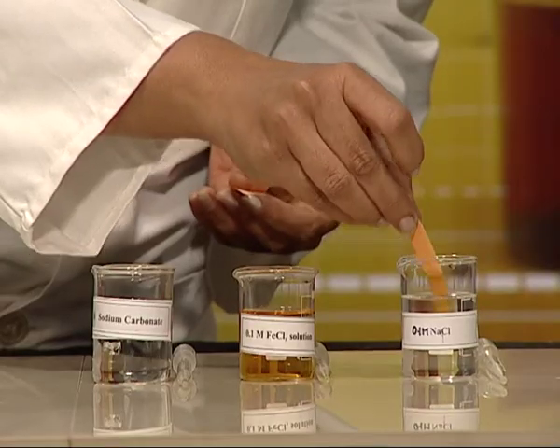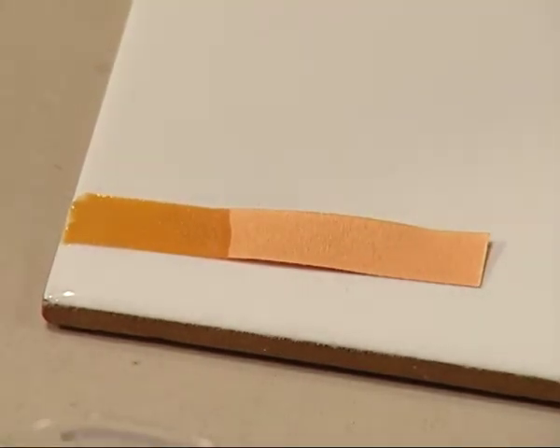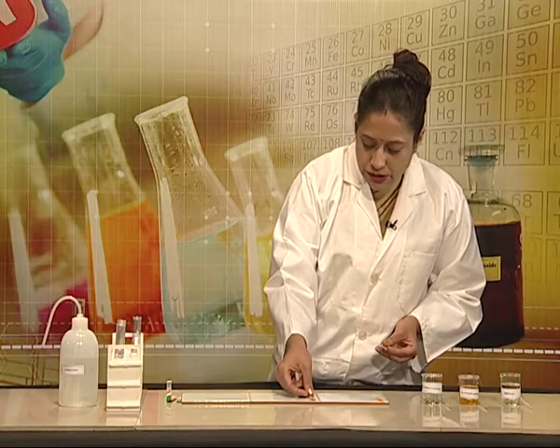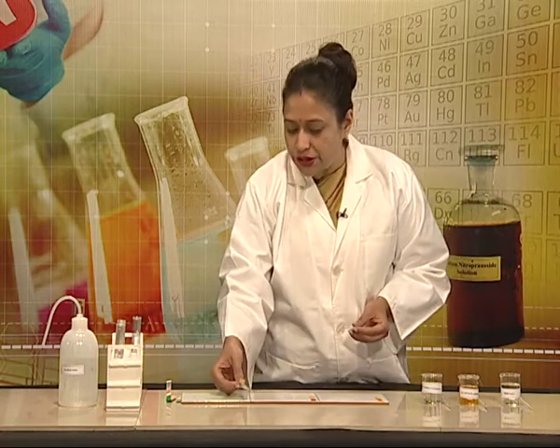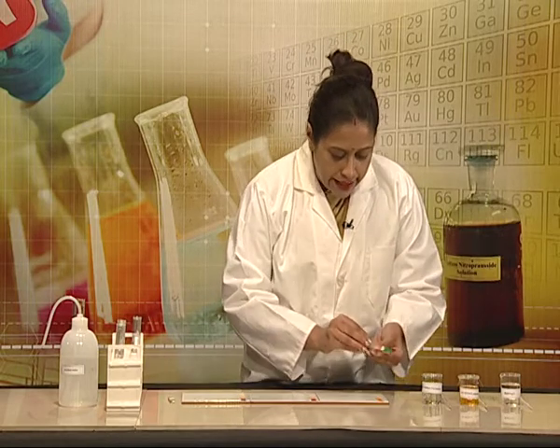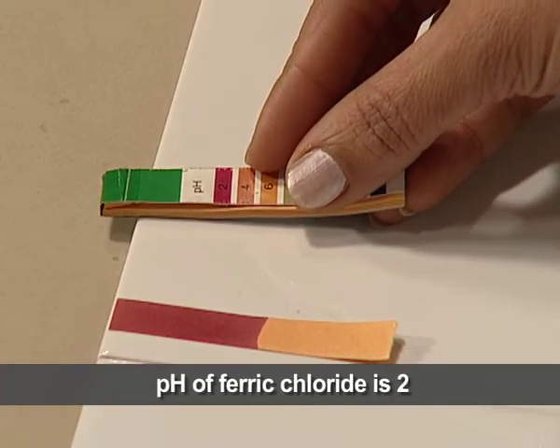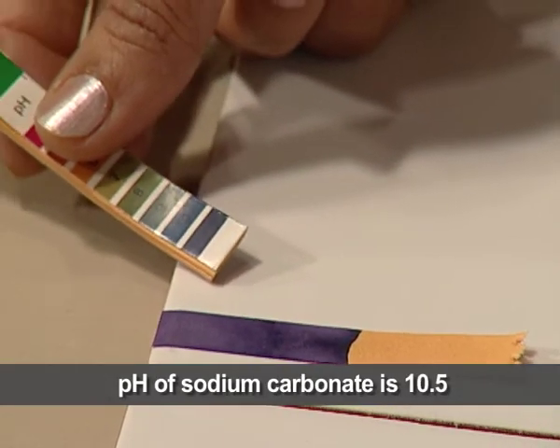Let us begin with sodium chloride solution and observe the change in the pH paper, if any. Now I will dip it in ferric chloride solution — the colour changes to pink. And in the third, that is sodium carbonate solution, the colour changes to blue. Let us match these colours with the pH chart. The sodium chloride matches with pH 6 to 7, ferric chloride corresponds to the pink colour indicating pH 2, and sodium carbonate corresponds to pH 10.5.